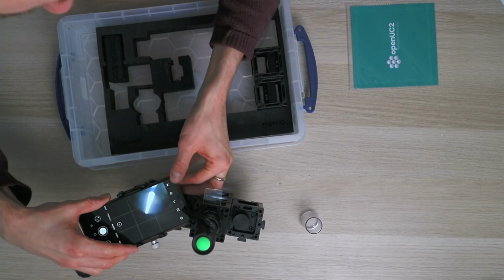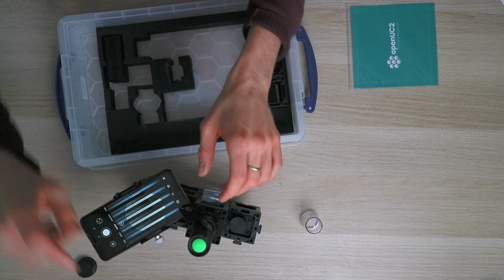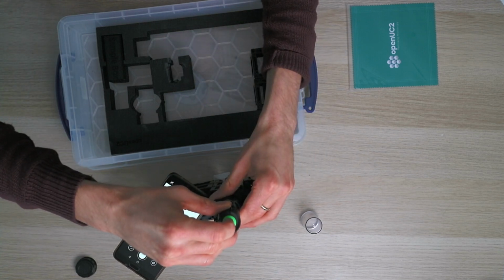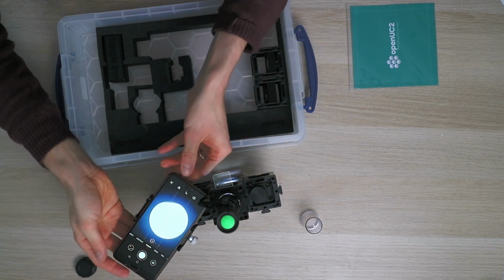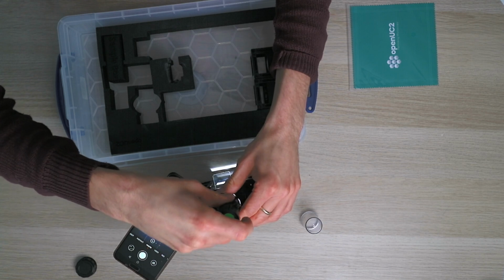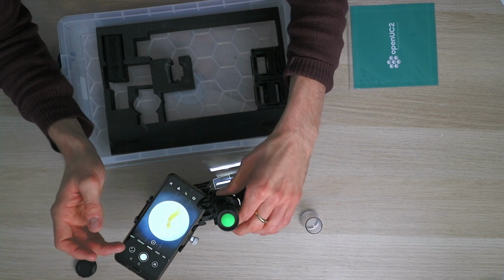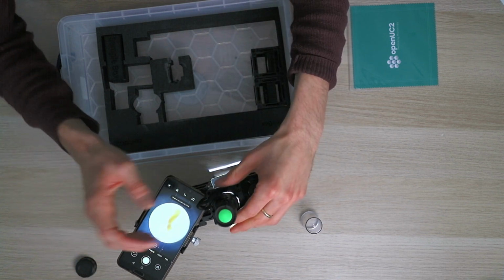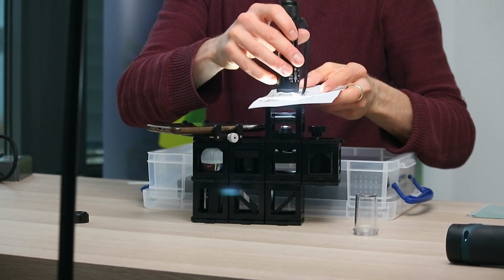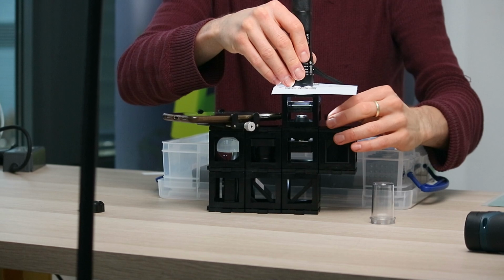So, interestingly, the power button is just at the same position where, so. And if you see this kind of flickering, you just have to turn on and off the light some more times because it's a little bit too smart for the camera. So, and then, well, it's really bright, this torch here. So maybe we take some piece of paper as a diffuser, and then you can focus the sample.